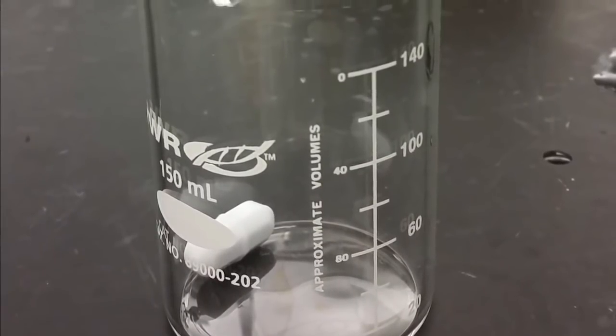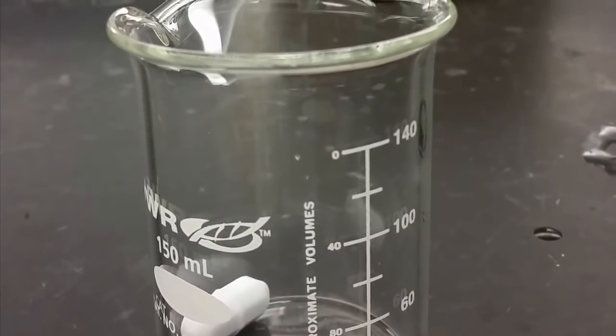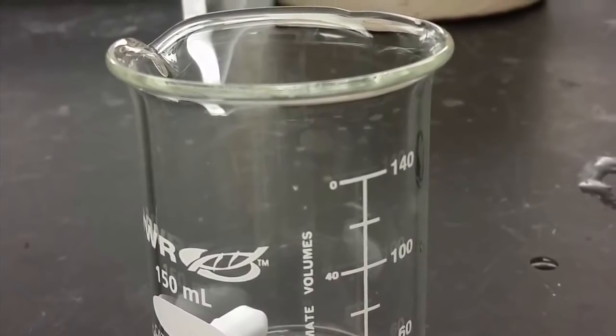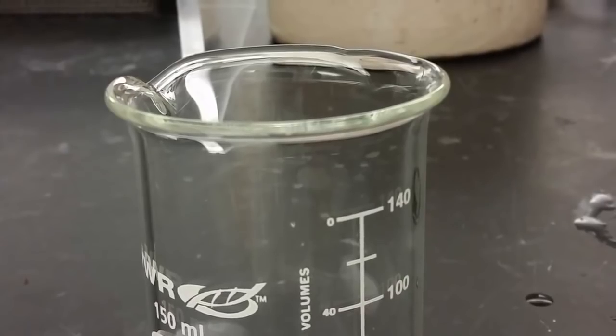You can set them aside for now, but remember it's very important that you use this 150 milliliter beaker for the titration and not one of the beakers from your drawer. This is necessary to ensure the sensors are able to record the data reliably.